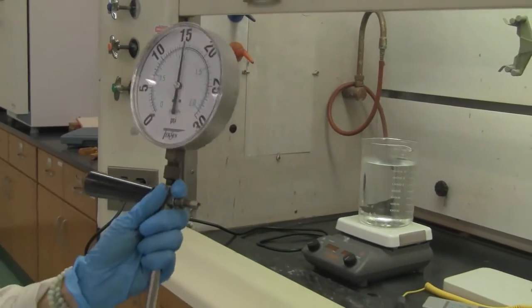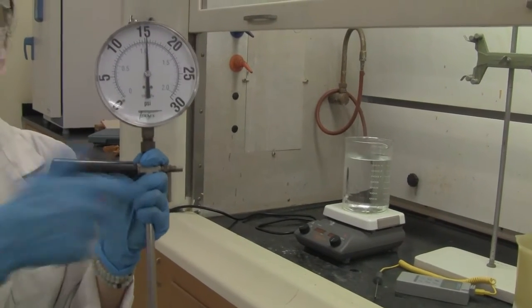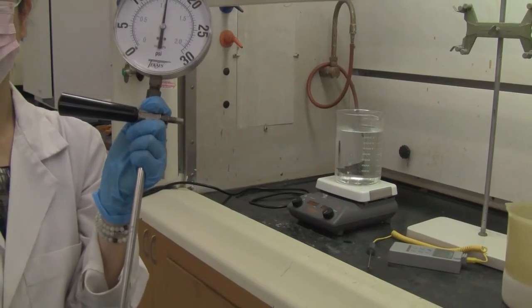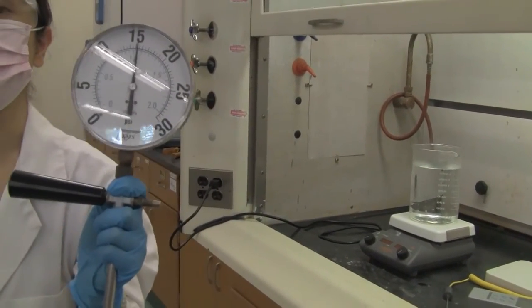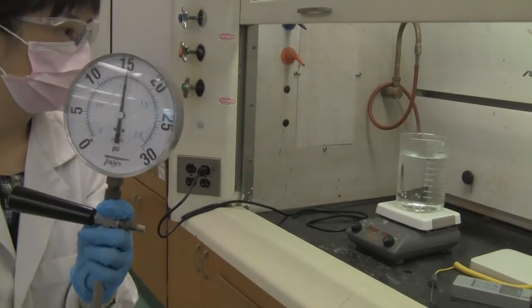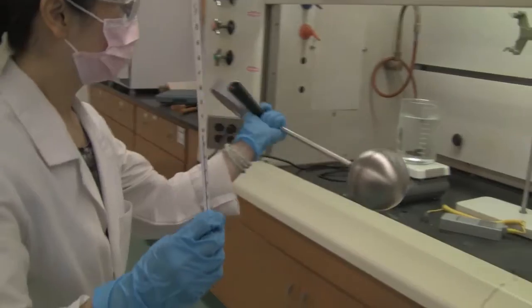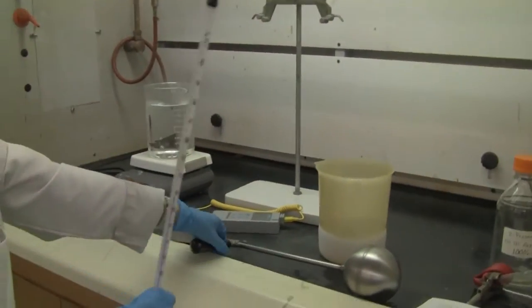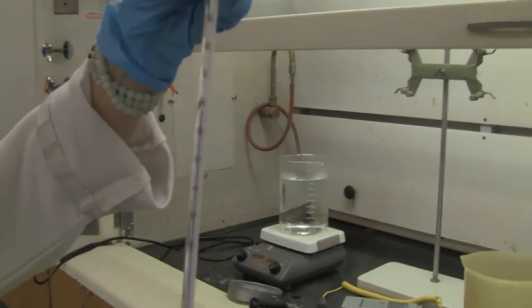Now our first temperature we want to measure is the room temperature, because it stayed in the room for quite a while, so it's very stable. What's the room temperature? We need to grab a thermometer. Can we get a very clear view of it? Okay, so now this is the room temperature.